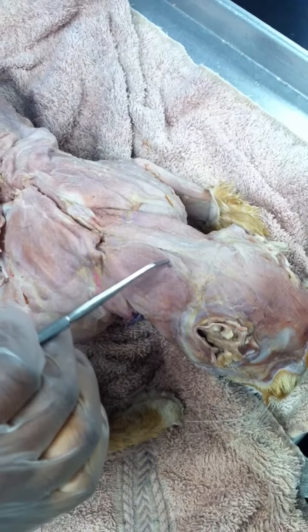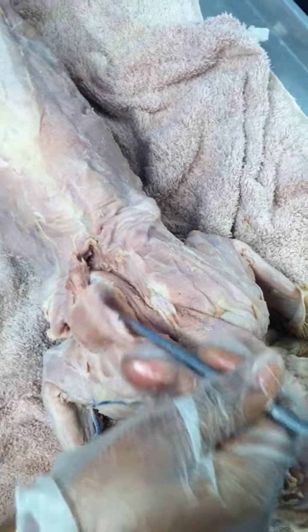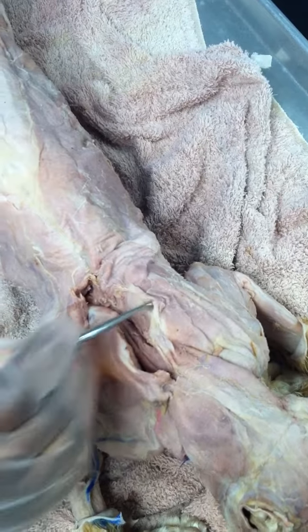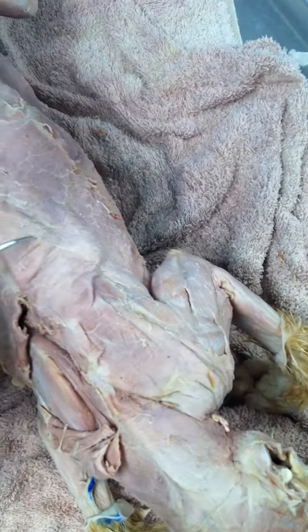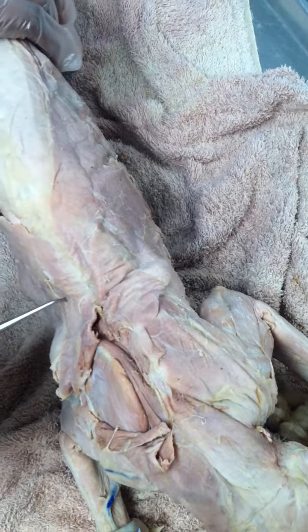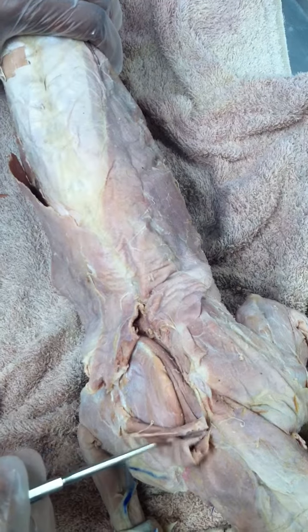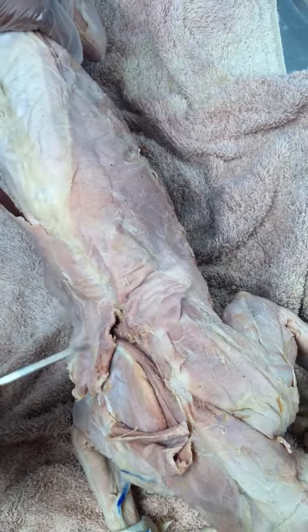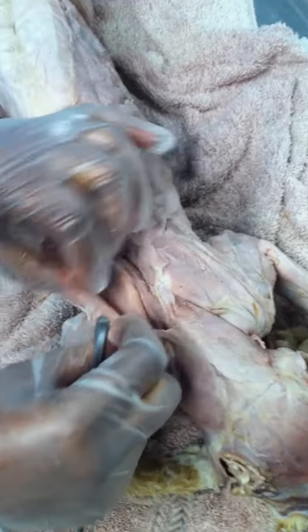Back of the neck, that's your clavotrapezius. On top of the scapula is a thin muscle, this muscle here on both sides, and that's your acromiotrapezius. And then you have a muscle underneath that, this one here, below that, that is your spinotrapezius. So clavotrapezius, acromiotrapezius, and then spinotrapezius. On the scapula, if you remove the acromiotrapezius, you expose the scapula.